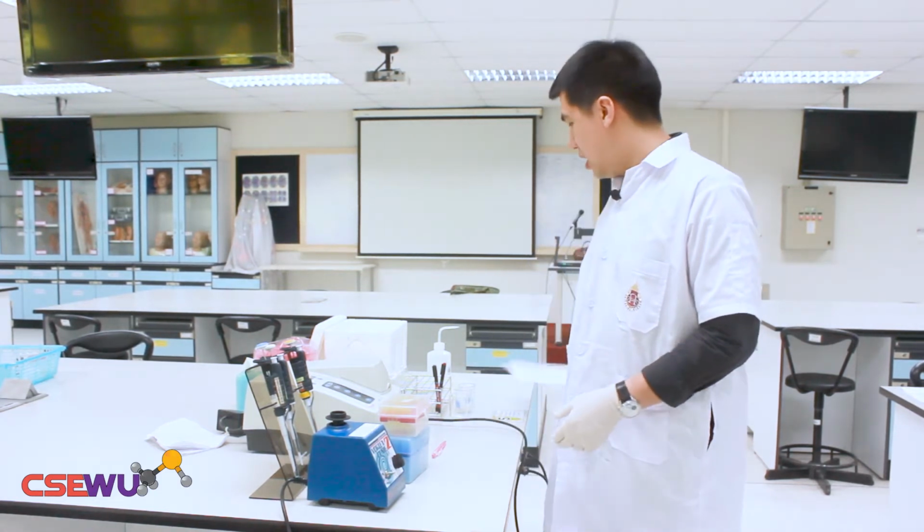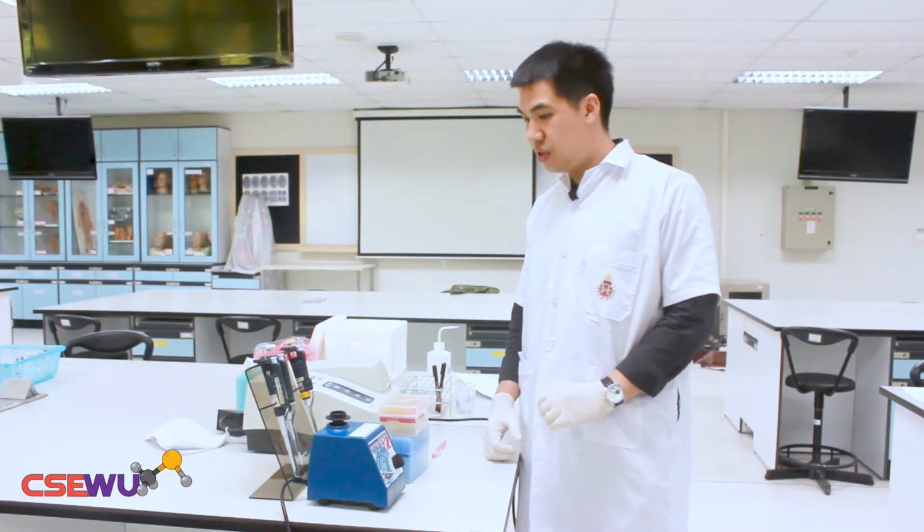So in the laboratory today we have two experiments. In experiment 1 we're going to prepare the standard curve of the glucose concentration. Before experiment 1, I'm going to show you the equipment and the consumables that we're going to use today.